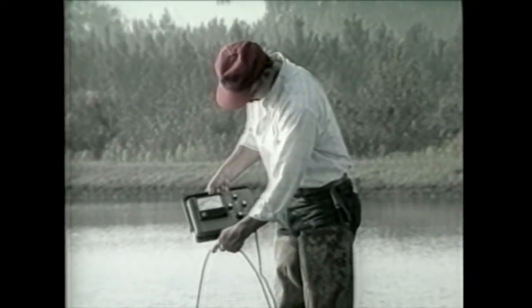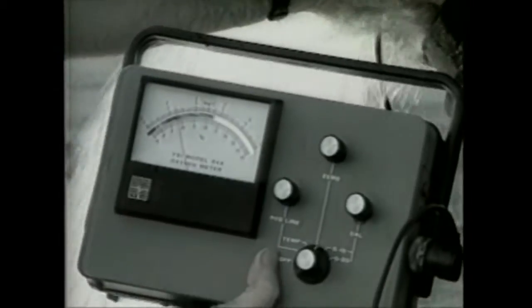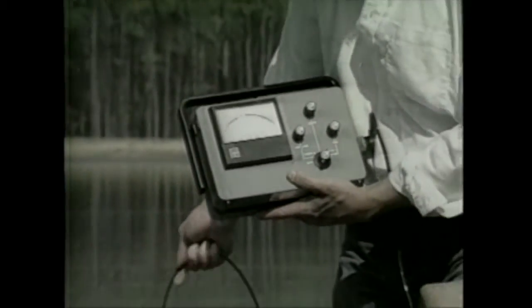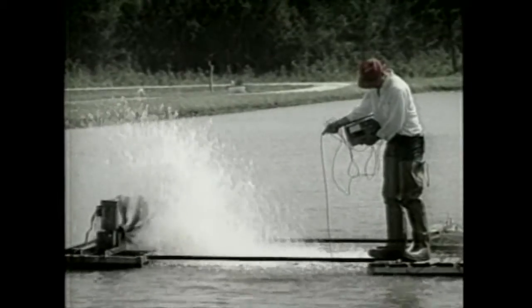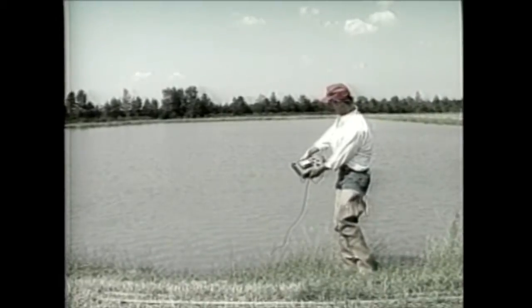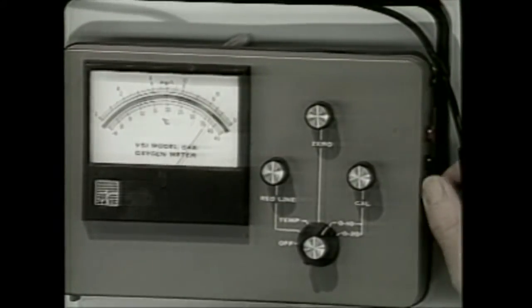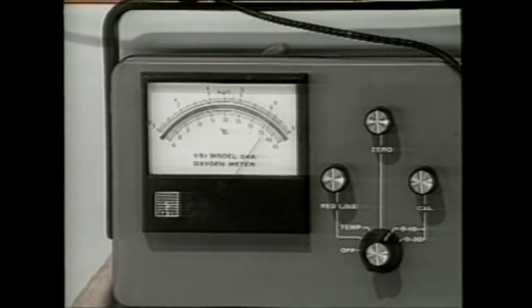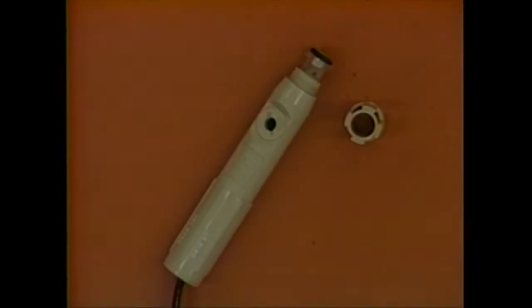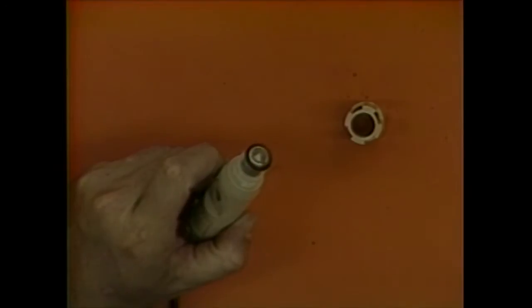If the oxygen reading is made near incoming well water, the value will be low since well water is low in oxygen. On the other hand, if oxygen is measured in a dense algae bloom, the reading will be abnormally high during the day and abnormally low at night. Oxygen will also be higher near aeration devices. It is also unwise to simply throw the probe out into the pond since the probe and cable may be damaged and the probe will sink into the mud. If properly used and cared for, your oxygen meter may be used for many years with little maintenance. Besides changing and recharging the batteries, the only part of the instrument that requires periodic care is the probe.